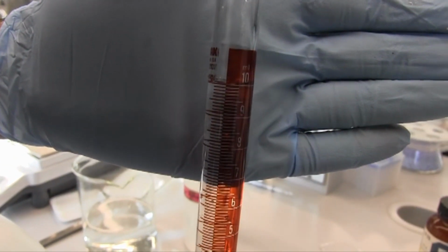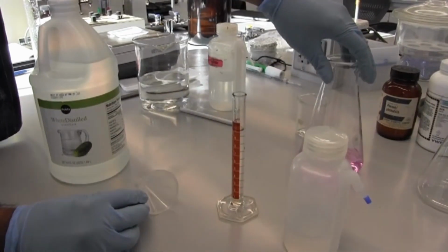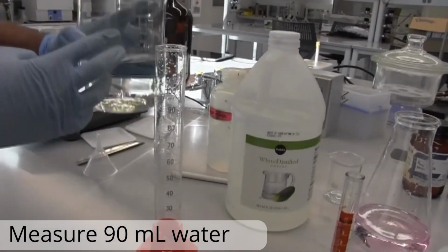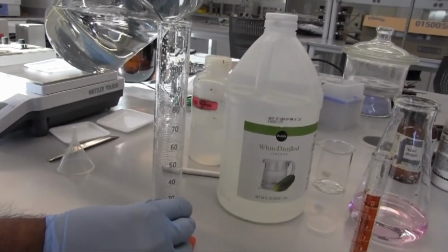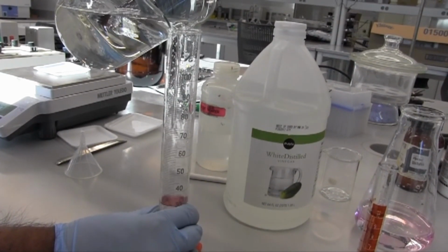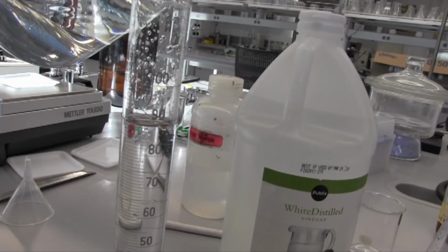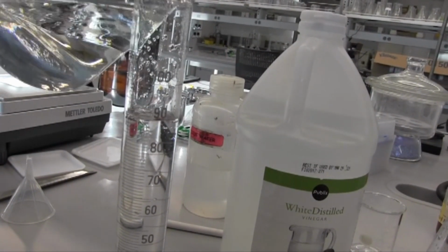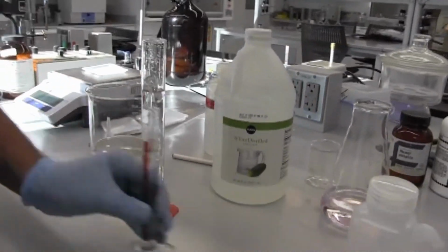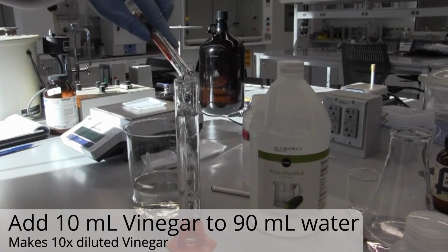And we're going to go ahead and dilute this 10 milliliters 10 times. So a 10 times dilution of this original jug. So we're going to get 90 milliliters of water into this graduated cylinder. We'll add our 10 milliliters to that 90 milliliters, thereby creating a 10 times dilution.